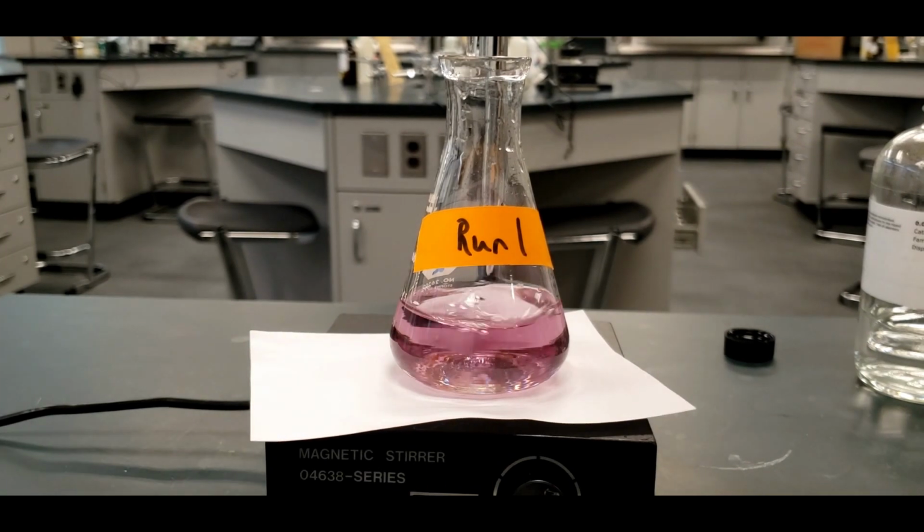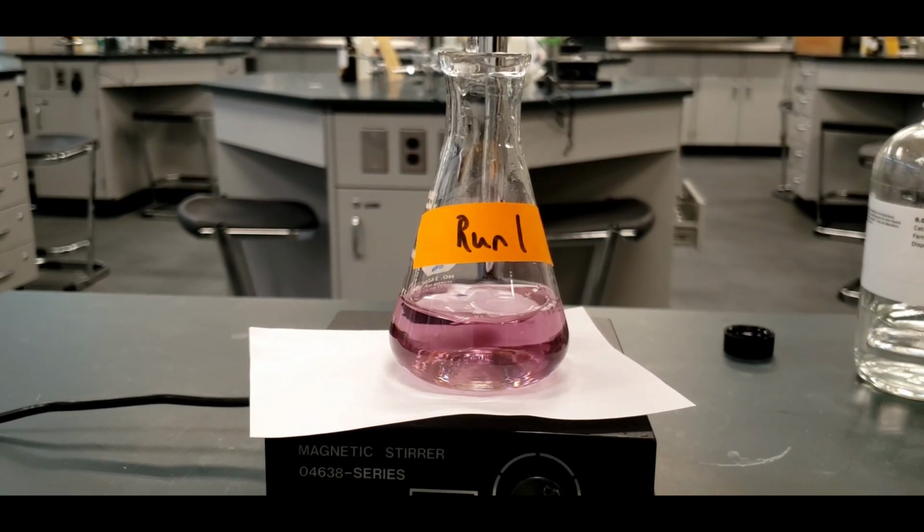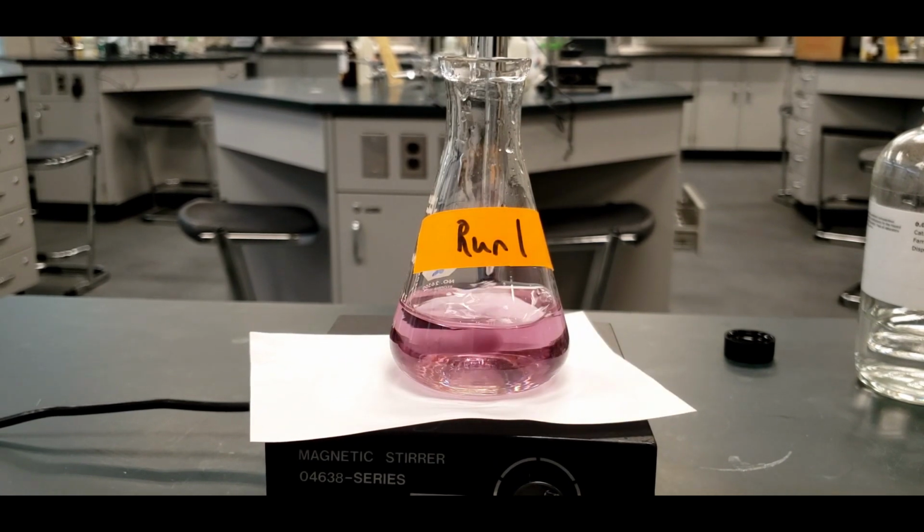All right, we're going to titrate run 1 with EDTA, and in this one there is calcium. So it contains everything the blank contained, but now it contains calcium, so we know we're going to have to add in at least 4.5 mils like we did the blank, so it should be over that, so I'm going to go a little bit faster.